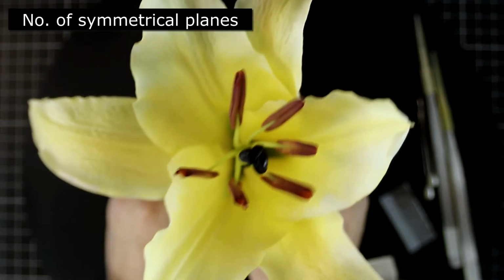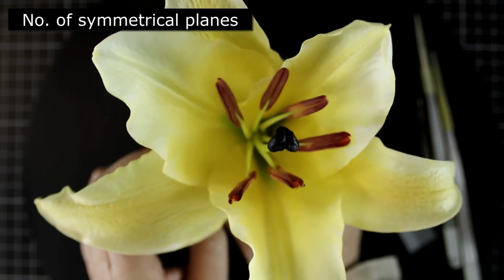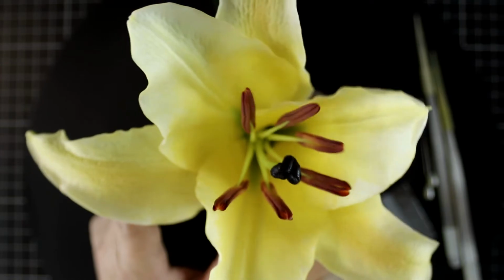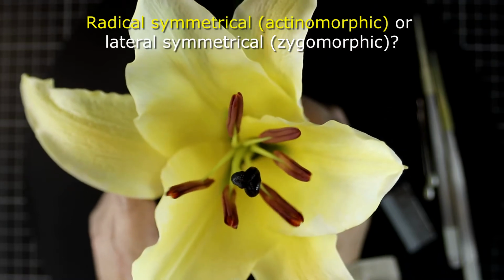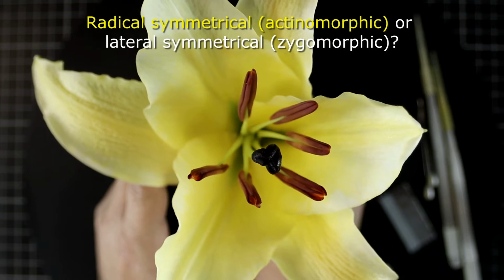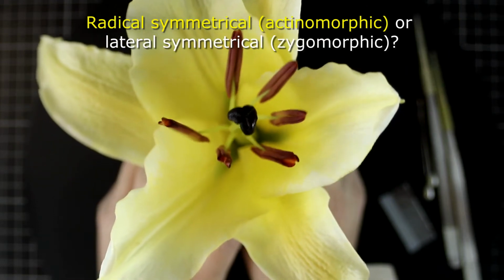How many symmetrical planes can you find? Probably it's more than one symmetrical plane. So this one can be described as radial symmetrical rather than zygomorphic. Or you can call it actinomorphic.